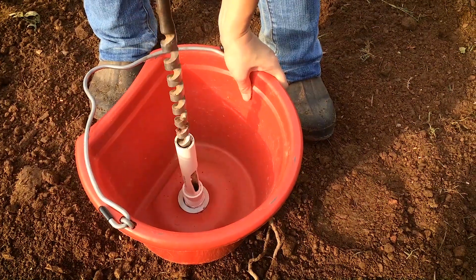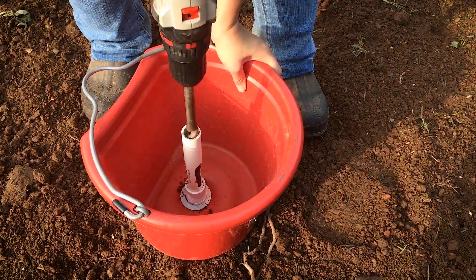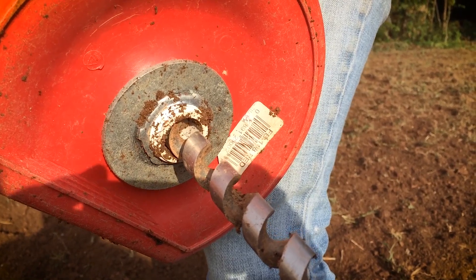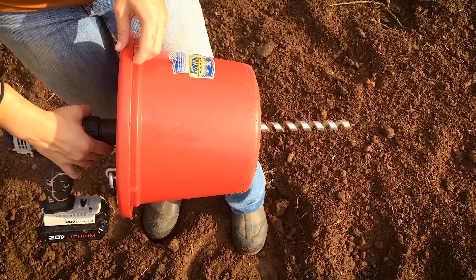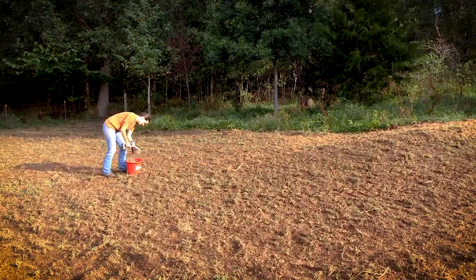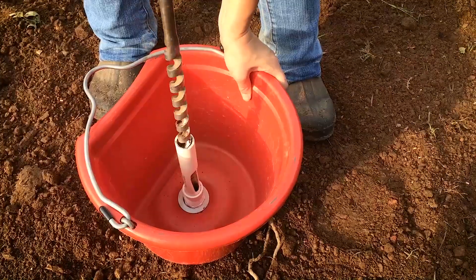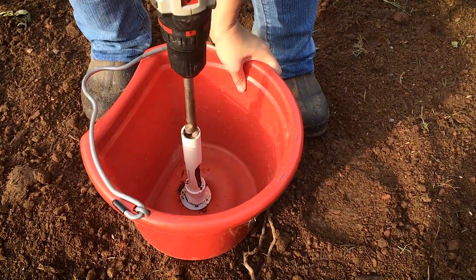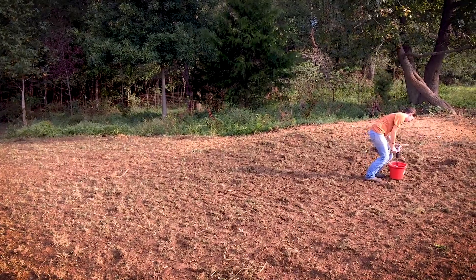Whenever you take the soil sample, make sure that you hold your hand firmly on the bucket as you drill down in. Your drill bit needs to be going in the clockwise direction and it needs to be firmly in the drill. When you go to take the soil sample, you drill straight into the ground and pull the drill back up going in the same direction. As the drill comes back out, the soil spins out of the grooves in the auger and is captured in the bucket. You do this for all of your subsamples.